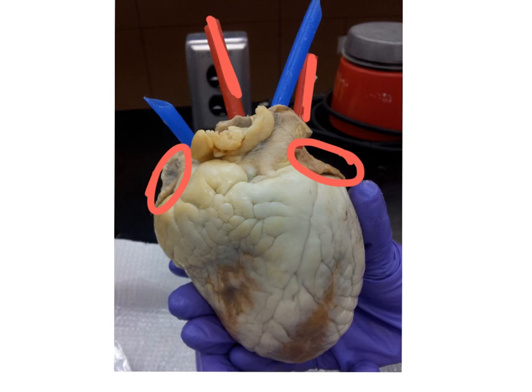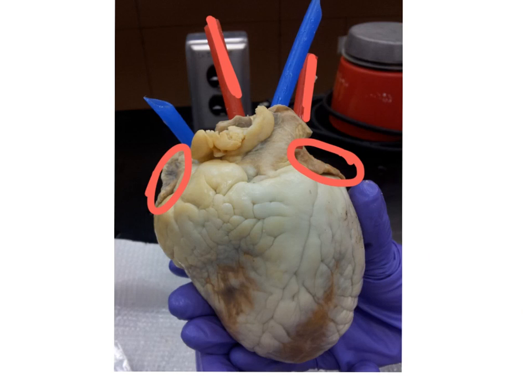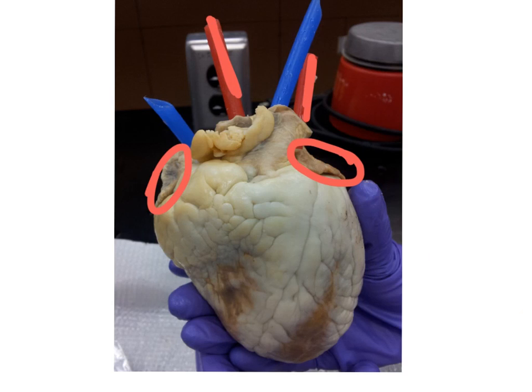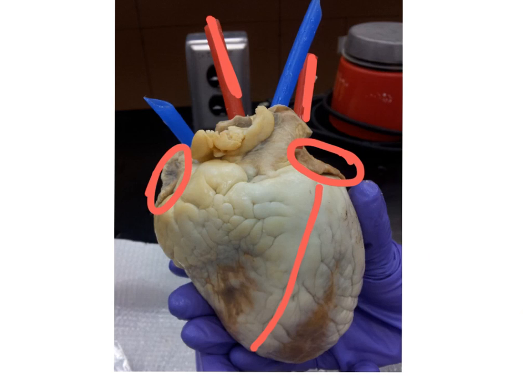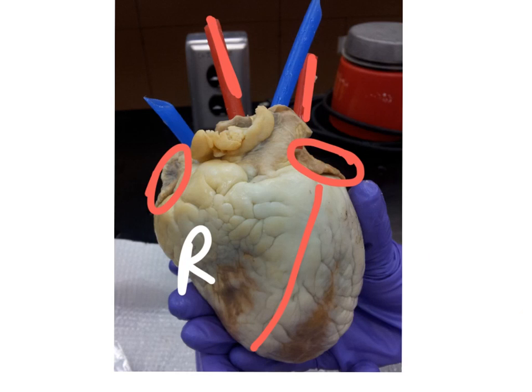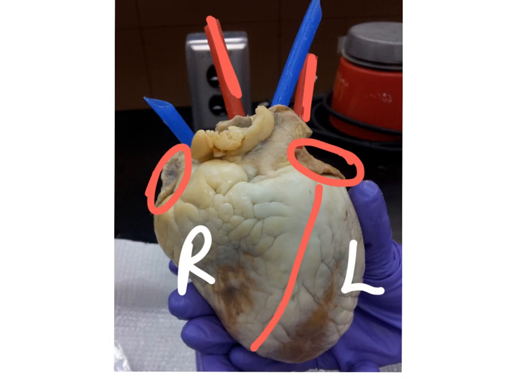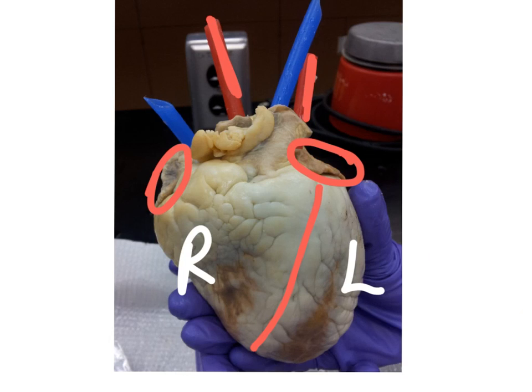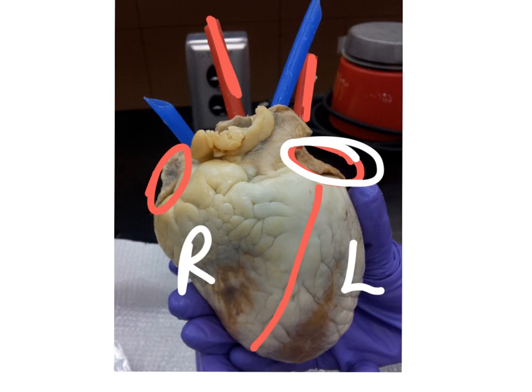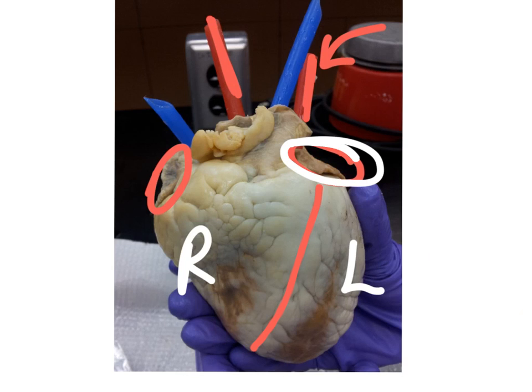Those are called the auricles, and those are just extra little flaps that can hold a reserve of blood should the blood volume increase in the heart. Remembering that this is an anterior view — the ventral view — so this is going to be the right and this is going to be the left. How to determine that this is the pulmonary vein is that it's going to be going into the left atria — that is the pulmonary vein returning blood from the lungs.